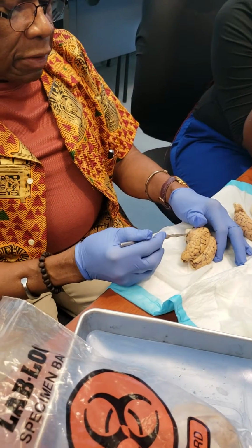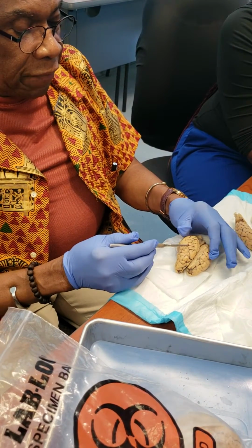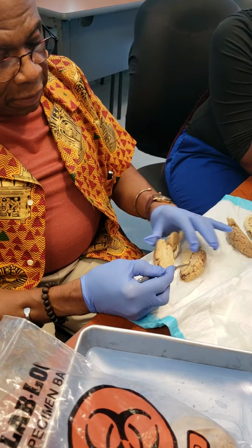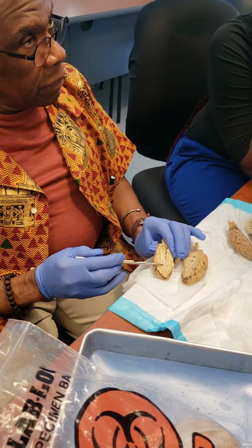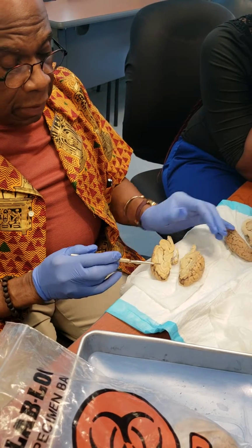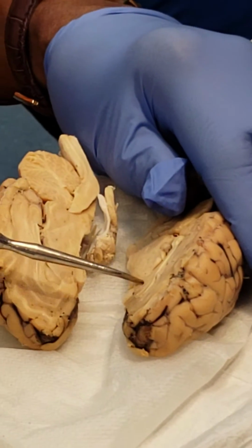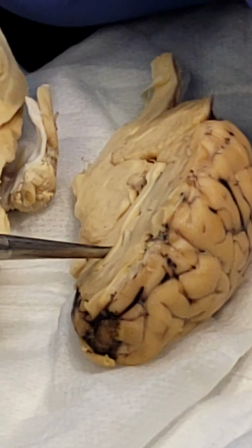Frontal lobe, temporal lobe, parietal lobes, longitudinal fissure. The longitudinal fissure will not penetrate this central area, which is the diencephalon. Now you can readily see in each one the corpus callosum, the part that communicates to the right and left lobes of the brain. Now, in addition to that, you see this? This is the septum pellucidum, the tissue that divides. Watch. See that? That's the lateral ventricle of the left hemisphere of the brain.